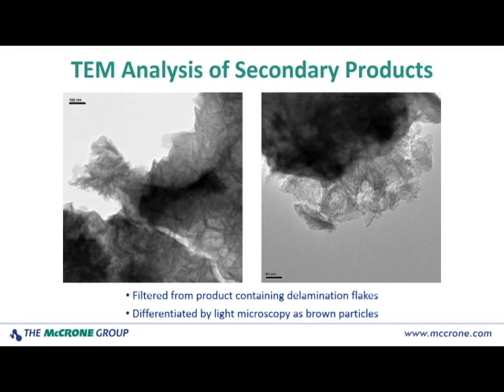I mentioned that formation of secondary products is a concern, and this is an example of something that you can easily see in the TEM, possibly not in the SEM. This was a filtered sample from a product known to contain delamination flakes, but looking at the material on the filter using light microscopy, there were brown particles evident that looked different from the delamination flakes. And the cleanroom microscopist was able to selectively pick out those types of particles for transfer to a TEM grid. And you can see that it's got a texture and almost a layering or needle-like appearance to the microstructure readily evident in the TEM that tells you this is probably something other than glass delamination.